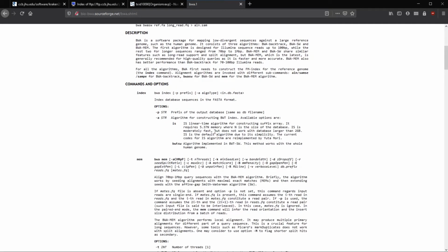So BWA. To create the index, it's really easy. We just have to type in BWA index, and then we don't need to worry about those, and we'll just put in our FASTA that we just downloaded. So back to Ubuntu, and here BWA index. So index is a program within the BWA package, and then we would just type in our mouse rna.fasta.